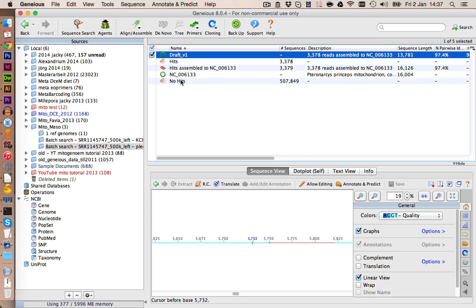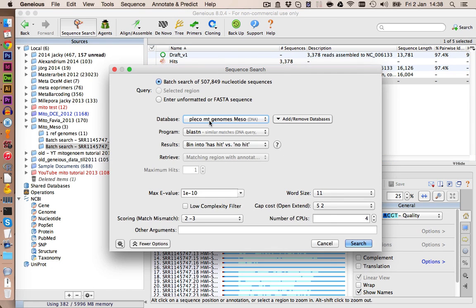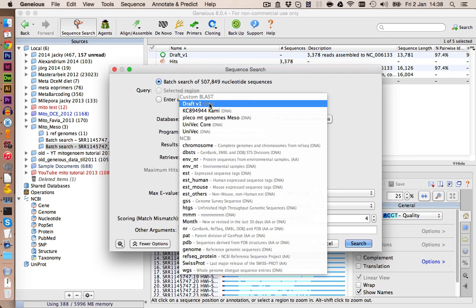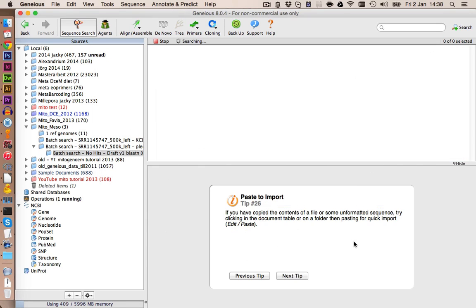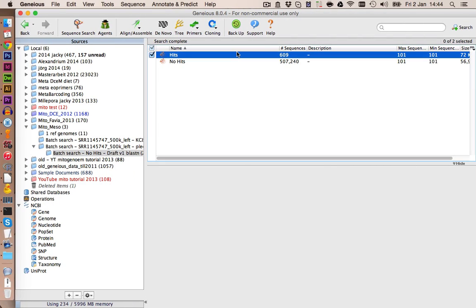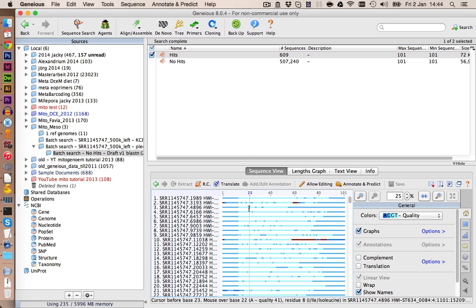Now we take our no hits, because here there could be still some more mitochondrial reads in here. And we're going to go on sequence search as before, select our new draft genome, and we again click on search. So I see you when the search is done. Okay, our blast search is done and it has found 600 additional reads.